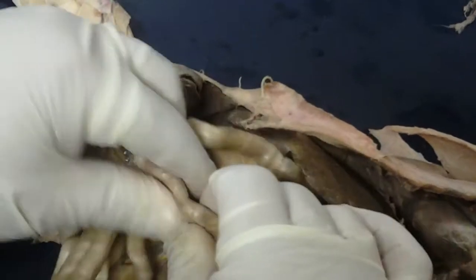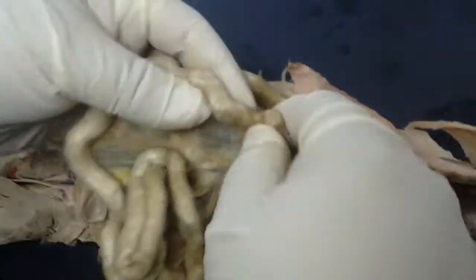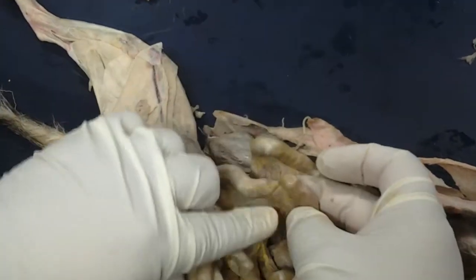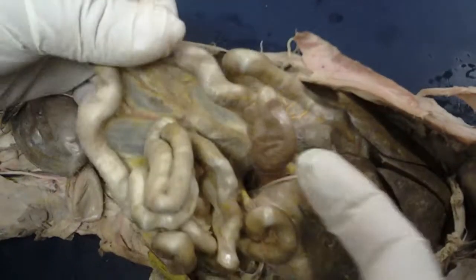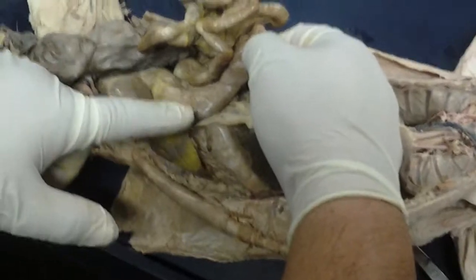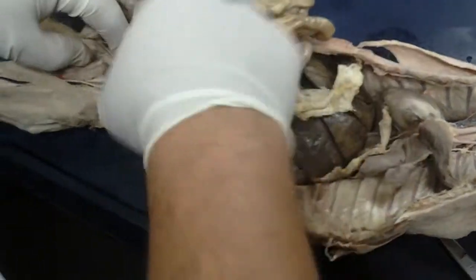Eventually that jejunum will also give way to the ileum, which is the latter part of the small intestine, eventually ending at the colon. The region of the colon where it ends is this pouch-like structure known as the cecum. At the end, you would also see the ileocecal valve, that one-way valve that moves materials into the cecum and prevents materials from coming back into the ileum. Now, in humans, once we get to the cecum, you would enter the ascending colon, transverse colon, descending colon, sigmoid colon, then rectum and anus.